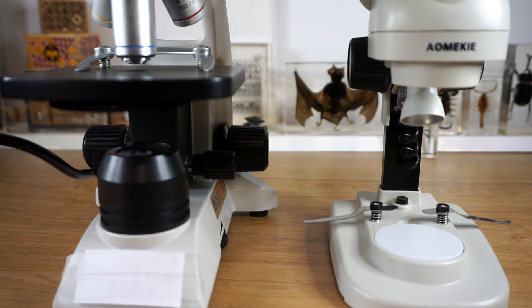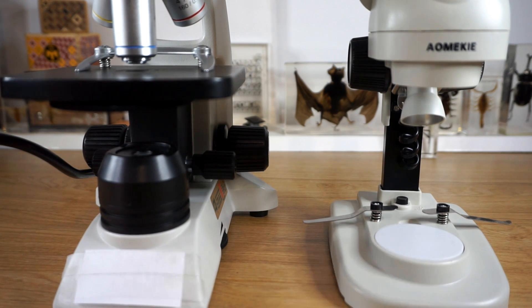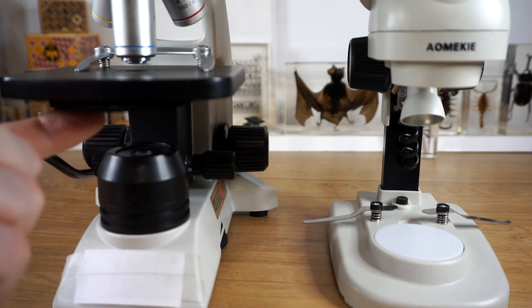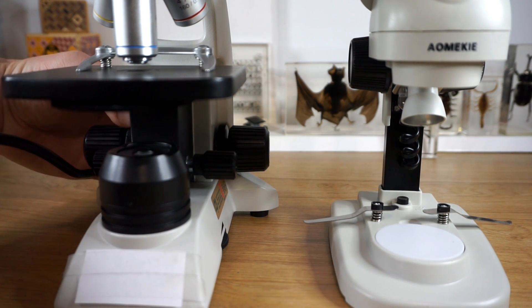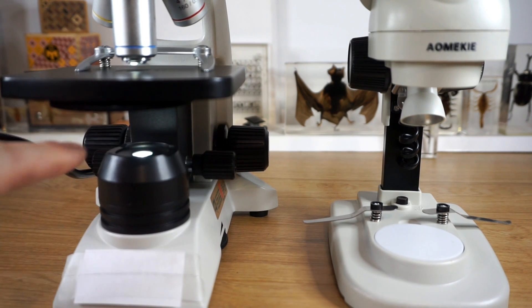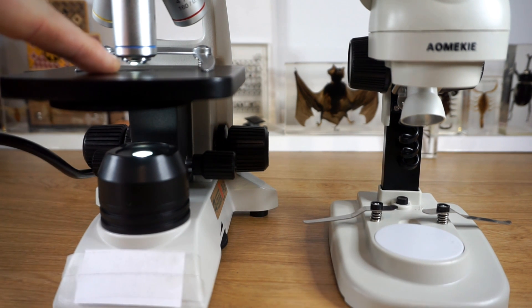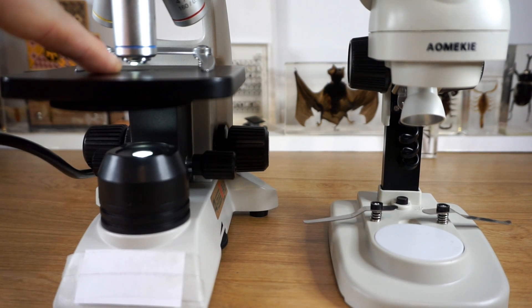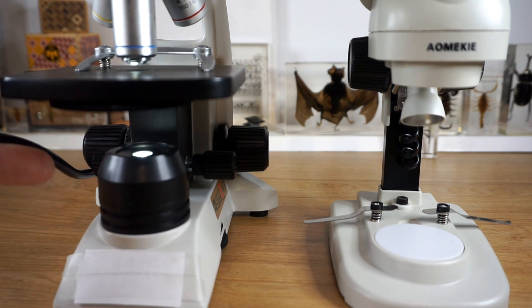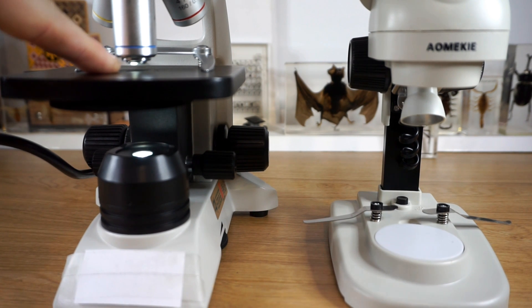Both microscopes benefit from having a lot of light shining onto your specimen. However, with a compound microscope, we have a lamp underneath the stage, and when I turn that lamp on, it shines a light that actually passes through the bottom of the stage and shines through your specimen. You generally can't see your specimen unless this light is on, or you might have a mirror that directs light up through the stage and through your specimen.